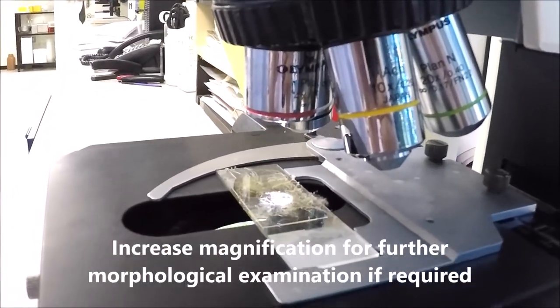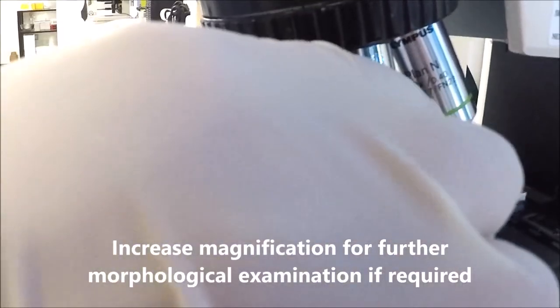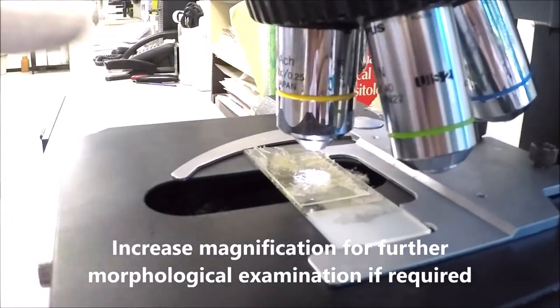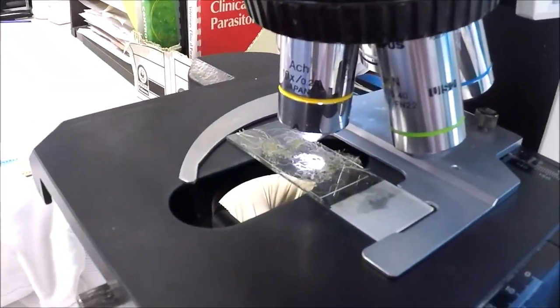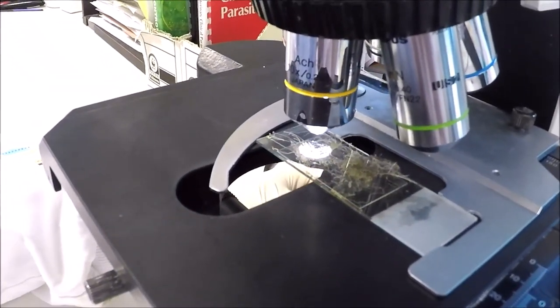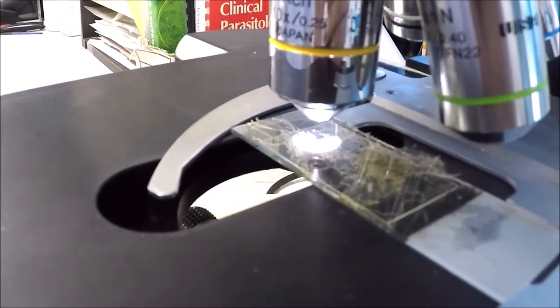Place your slide onto the microscope stage. Using your 4x and 10x lens, scan the whole slide for the presence of ectoparasites. You can increase your magnification for further morphological examination.